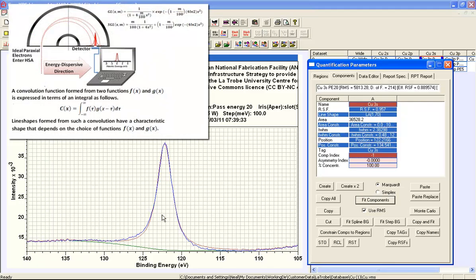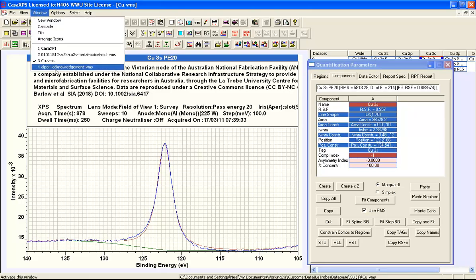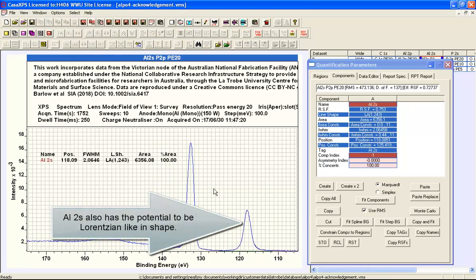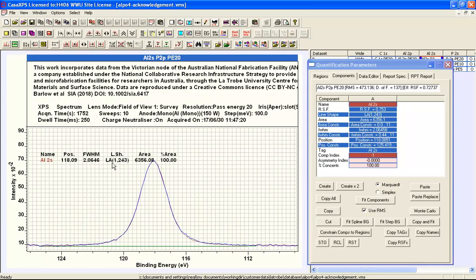And looking at these data in terms of the type of shape that we should expect, it may not be identical to what we see in the data set that we're really interested in, but at least it does show that we're looking for a full width half maximum that is somewhere between 2 and 2.5, and that a Lorentzian shape would be expected. Similarly, we can look at other data that involves aluminium, and if we focus on an aluminium peak, we can see that a Lorentzian-like shape fits this aluminium 2s quite nicely.